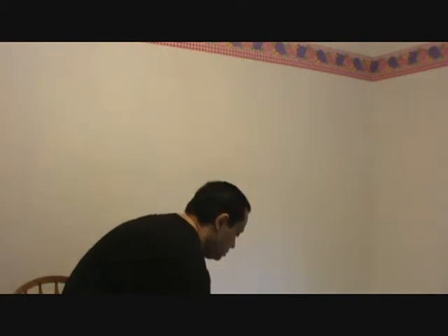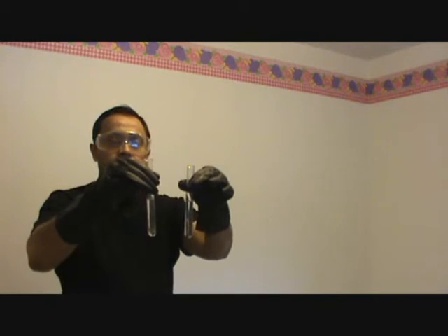In this test tube I have placed graphite from pencil in butan-2-ol, and you can see that it has not dissolved. In this test tube I have placed graphite in hexane, and again you can see that it has not dissolved. Now I have added a strip of magnesium to butan-2-ol and a strip of magnesium to hexane. As you can see, in both of them magnesium is insoluble.